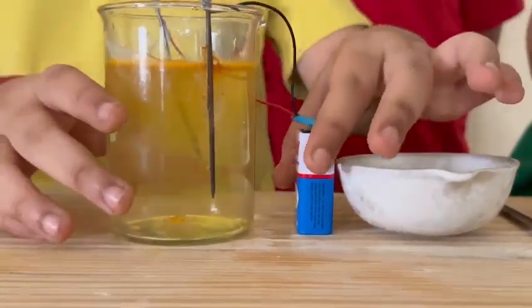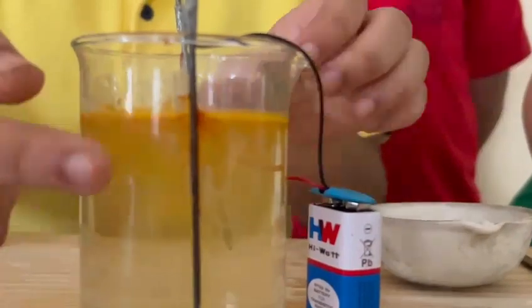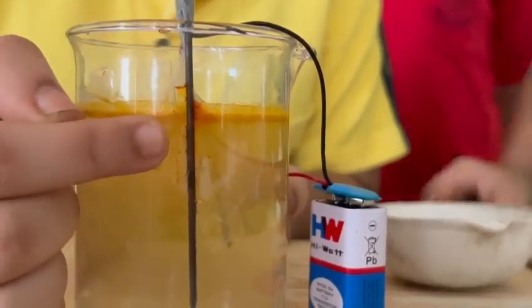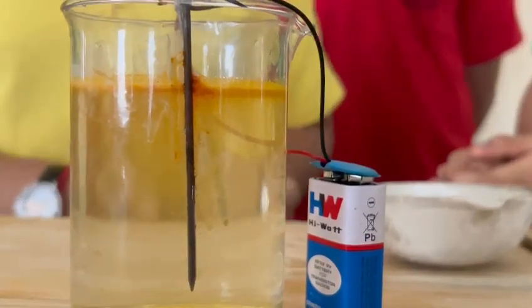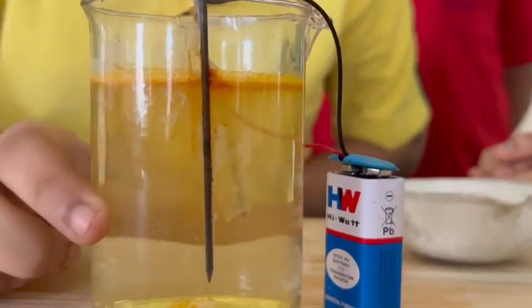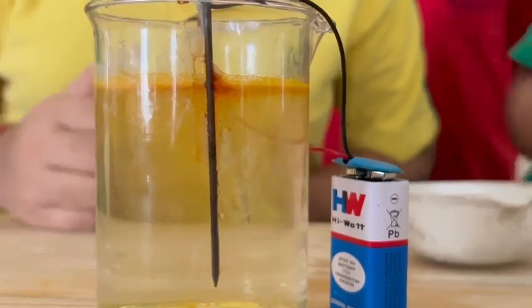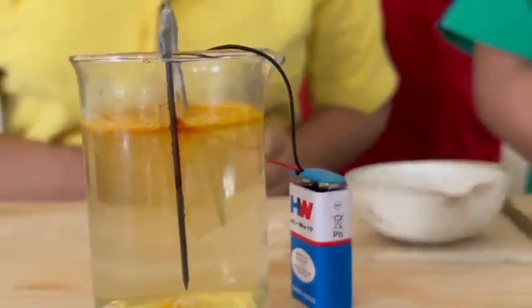Just observe it here — the color of the solution is starting to change. It is turning red. Do you know why? It is because NaOH is being formed in the solution, which is basic in nature, and it has turned the yellow color of turmeric to red.